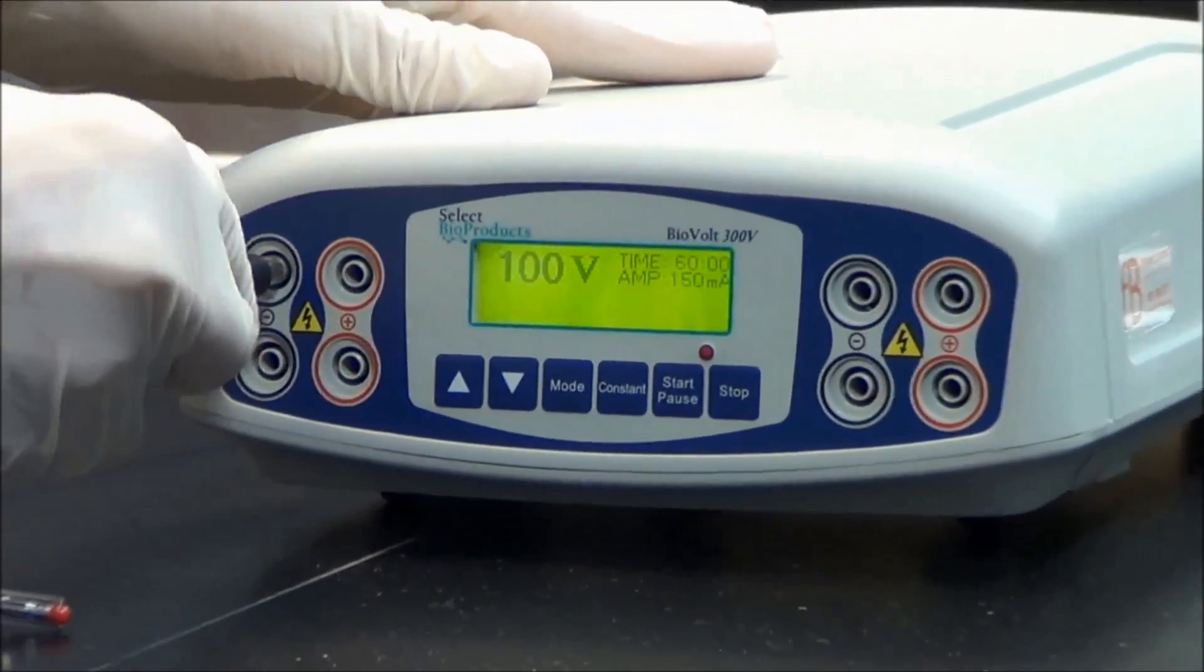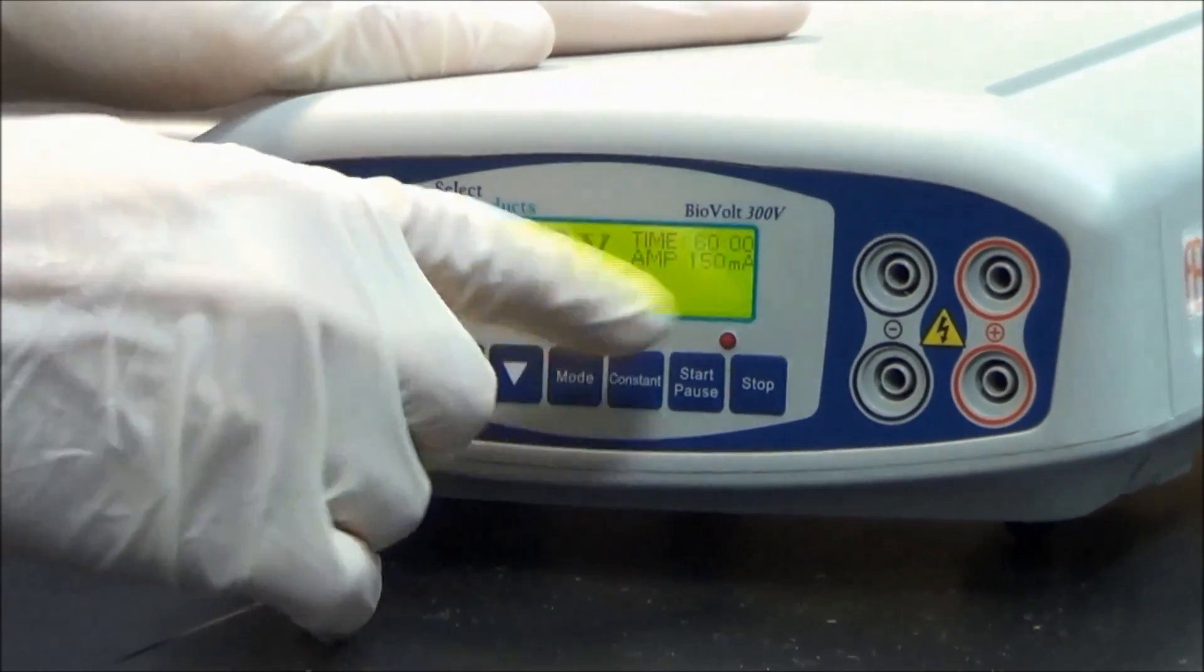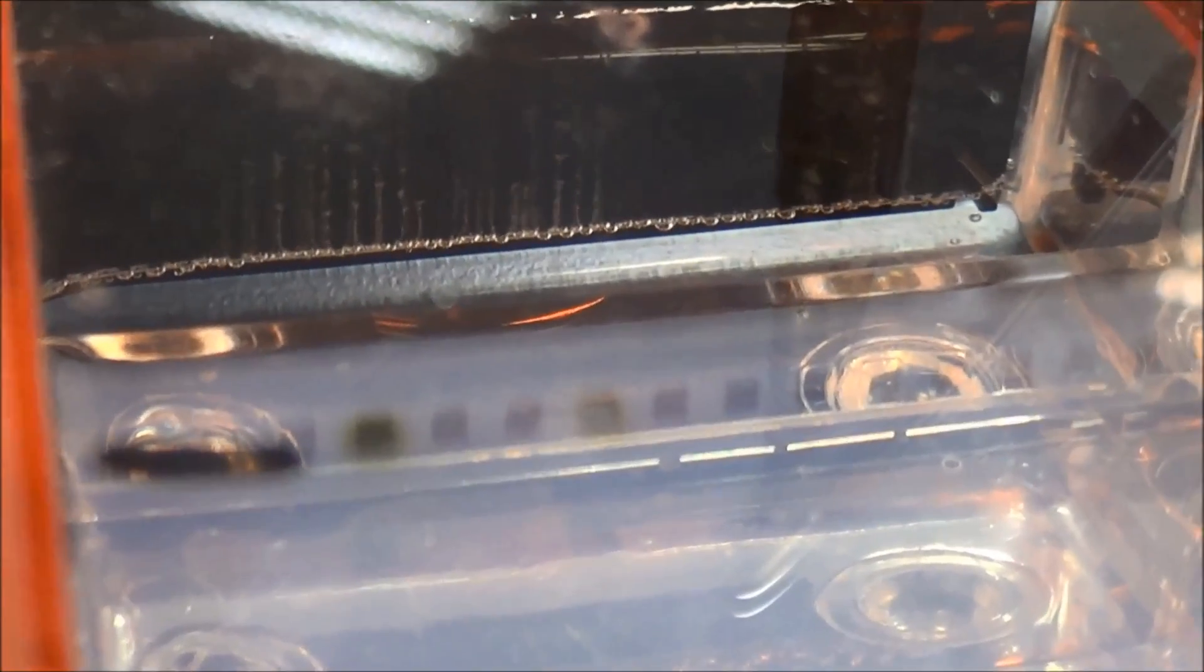Run the gel for 1 hour at 100 volts. Check for bubbles which indicate that the gel is running.